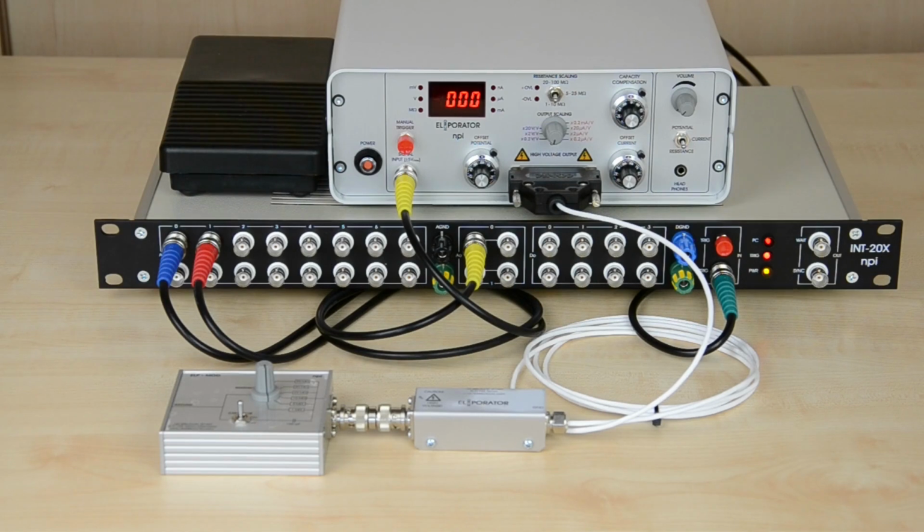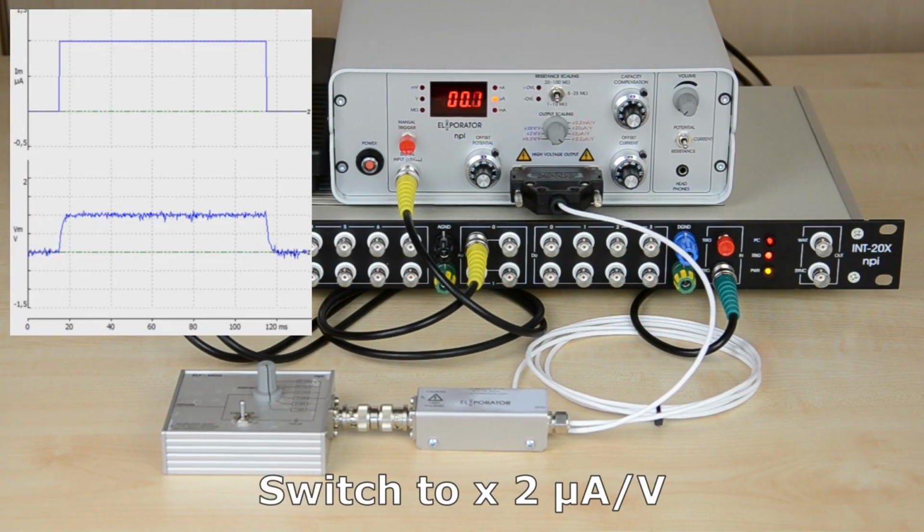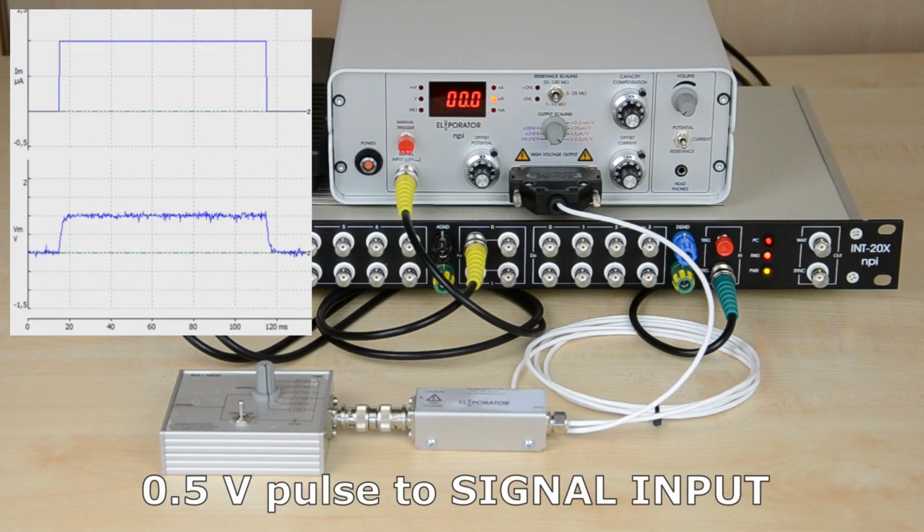Set the electroporator to current mode by selecting one of the current ranges in red. In this example, we choose 2 microampere per volt. A 0.5 volt square pulse at the signal input will be translated into a 1 microampere square pulse at the output.